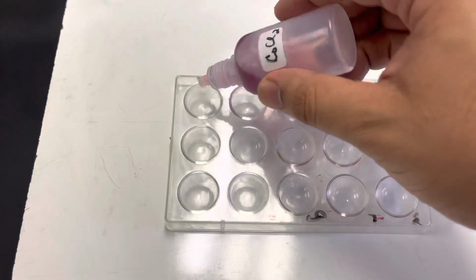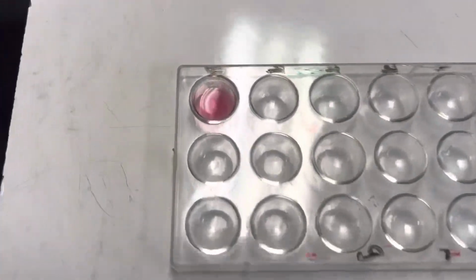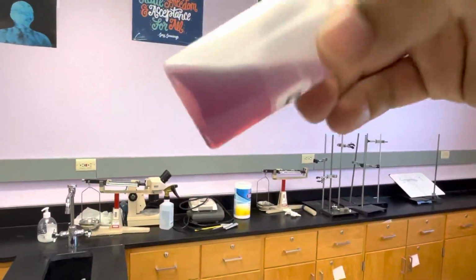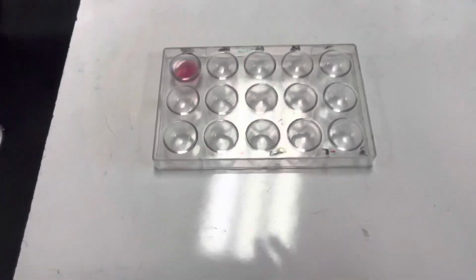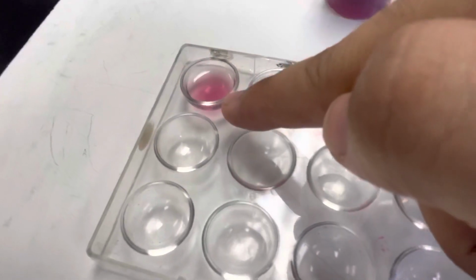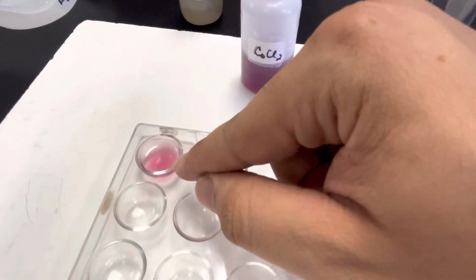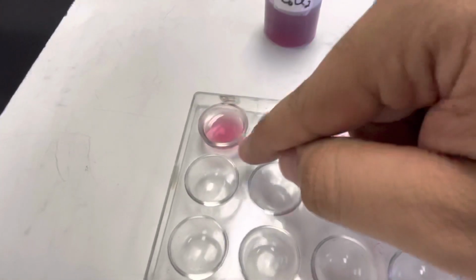Anyway, when I put it in my well here, we can see the color really clearly, and it's like a lavendery color. You actually can't see it super well on camera. Anyway, it's like a pale-ish lavender, magenta-ish maybe. But that's going to serve as our control for the rest of the stresses we're going to do to the system, because we have to remember that this is a reversible reaction in equilibrium. This is our cobalt hexahydrate in equilibrium with the product, which is the cobalt tetrachloride. So make sure you're looking at the chemical equation on your paper to make sense of what I'm talking about here, right? This is at equilibrium.